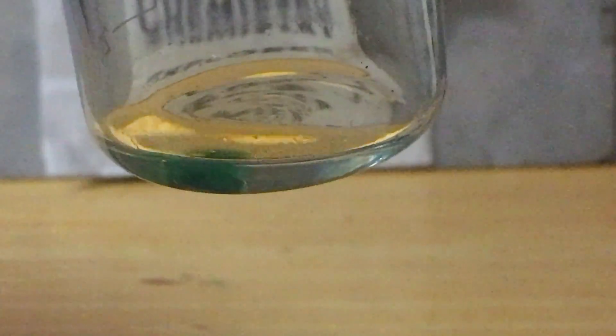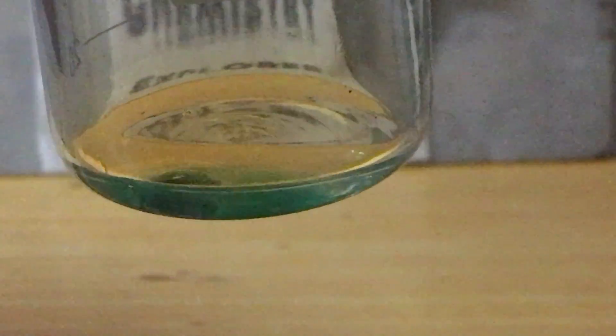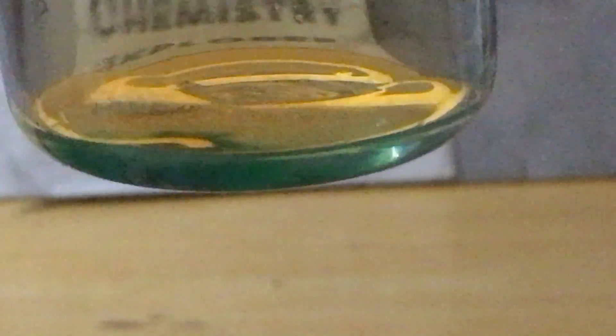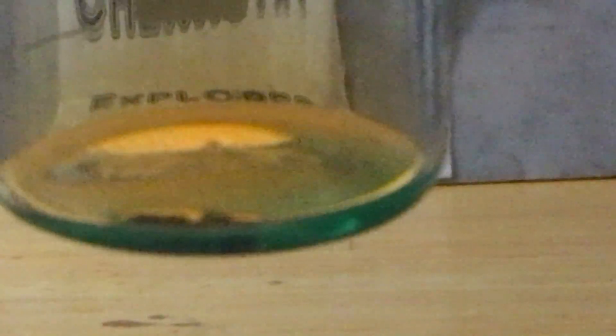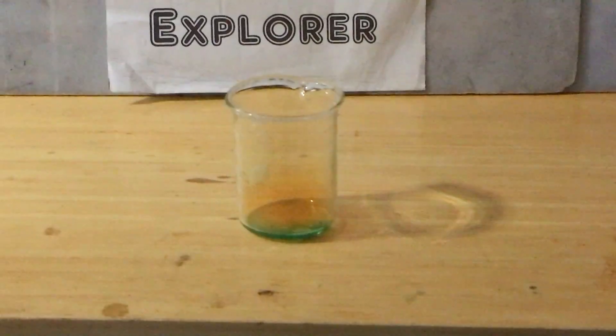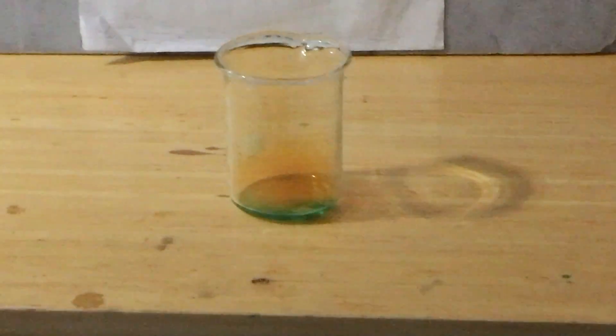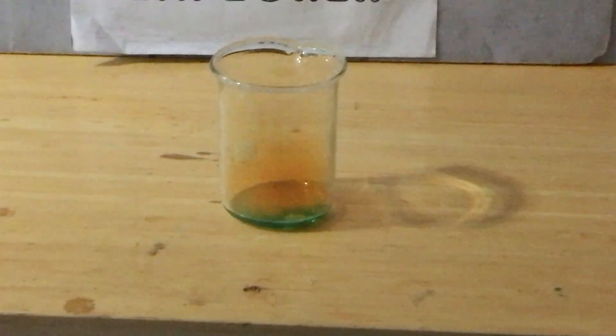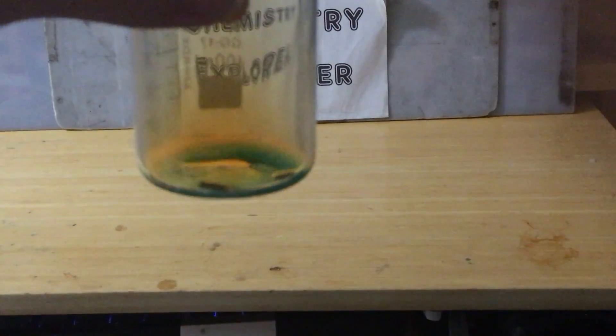So let's test out the concentrated nitric acid. To the acid, I added a few pieces of copper metal. As you can see, the solution quickly turns blue. Also, a brown gas is evolved. You can also hear some hissing sound due to the gas formed. However, the reaction is not too fast due to the poor quality of the copper. However, if I've used copper powder, the reaction will be much quicker.